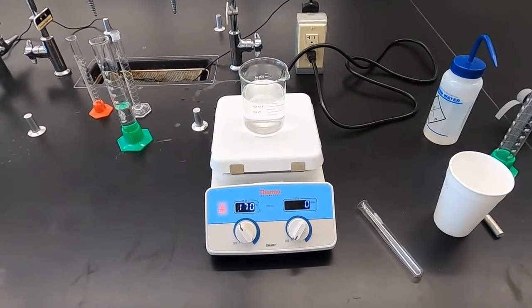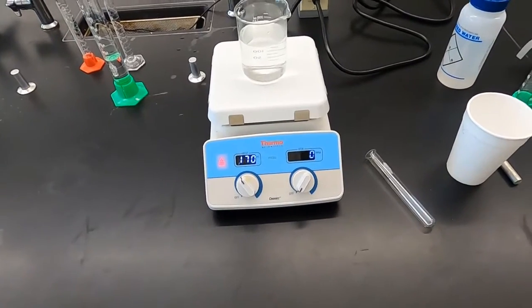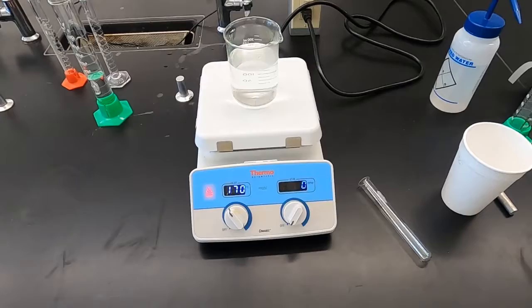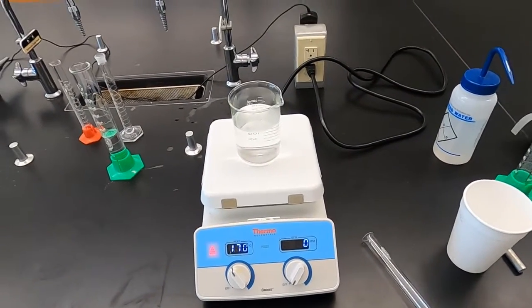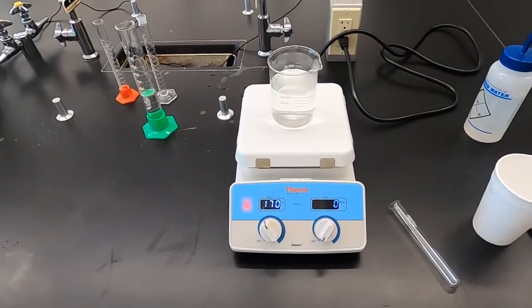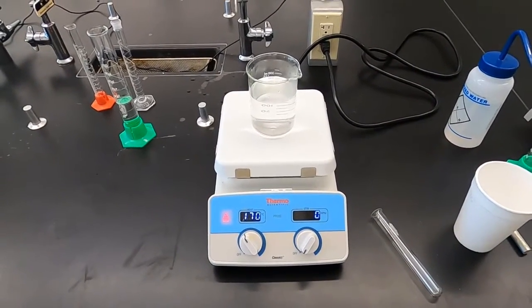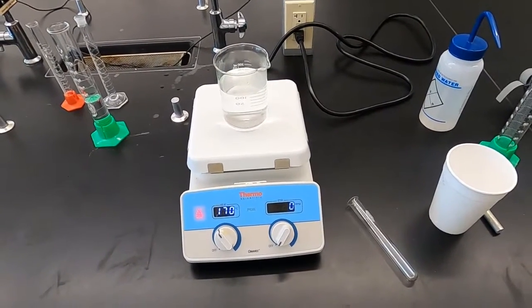Welcome to the Calorimetry lab for Chem 2AL. Today we're going to be looking at the change in heat for different physical changes and different chemical reactions that will take place. So what we are trying to find, mainly by performing this reaction, is that change in temperature, which, to answer the questions at the end, will give us specific heat or enthalpy.